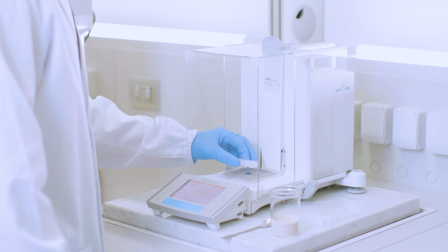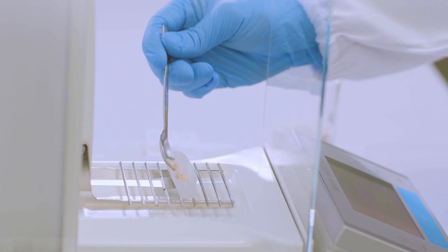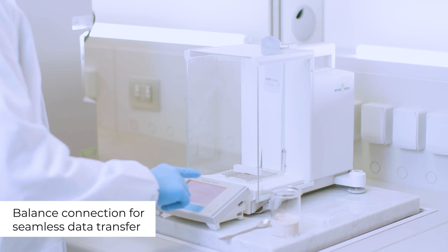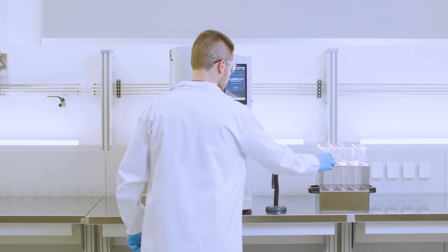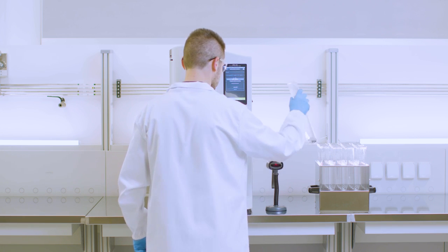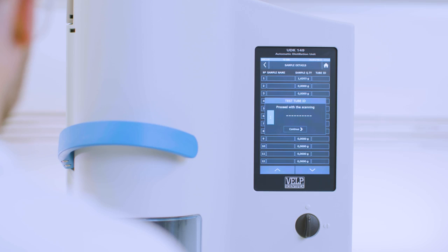To start, homogenize the sample and transfer it into a VELP test tube. Connect the UDK 149 to a balance for seamless data transfer. The optional barcode reader simplifies data management and speeds up the analysis preparation, avoiding transcription errors.